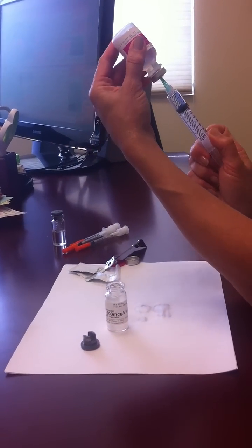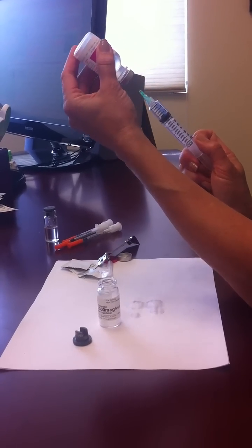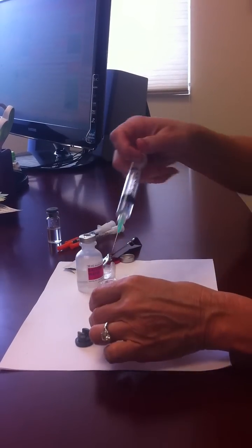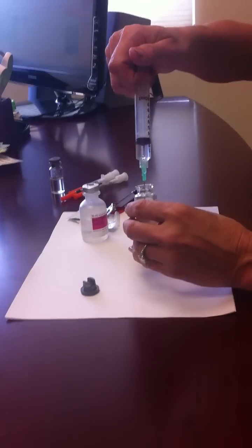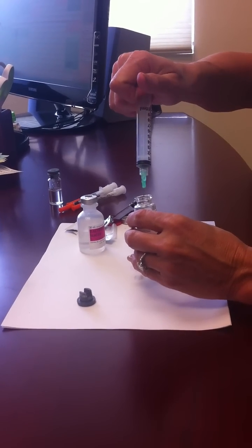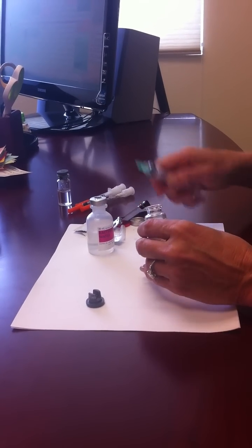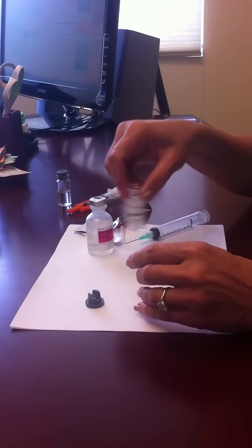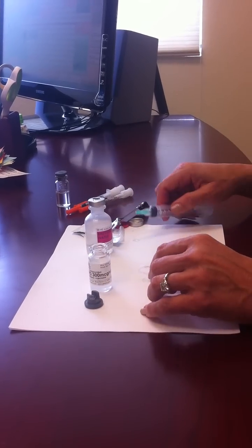And you want to go to the bottom of that stopper, that black stopper. And then you just put it into your vial and swirl gently. And that's all there is to it.